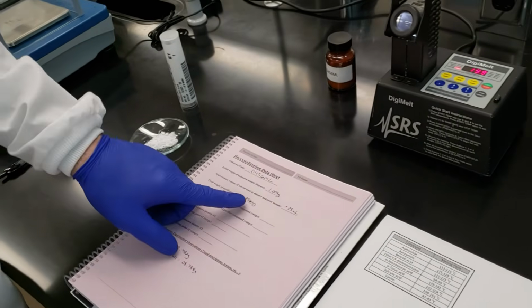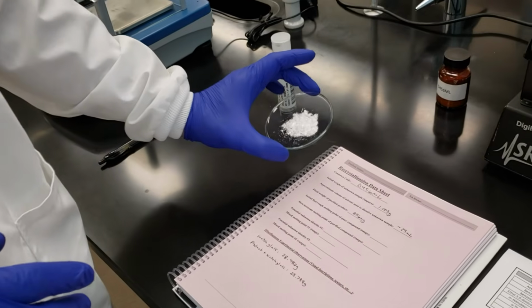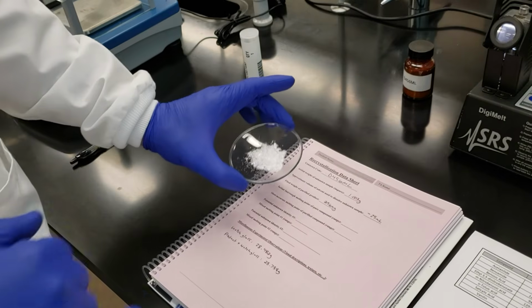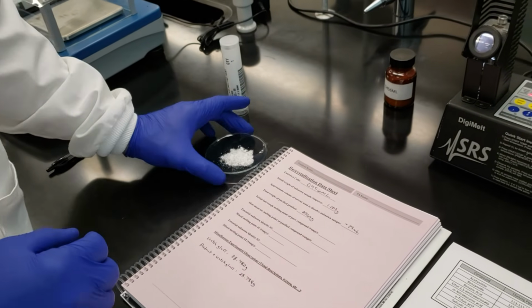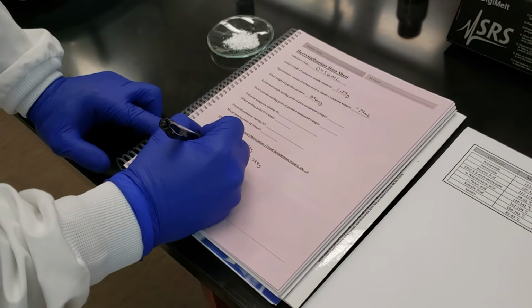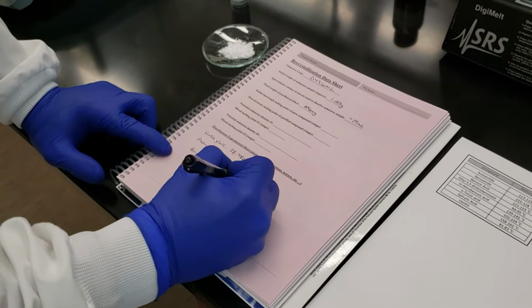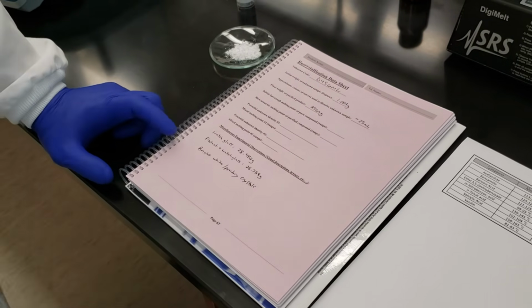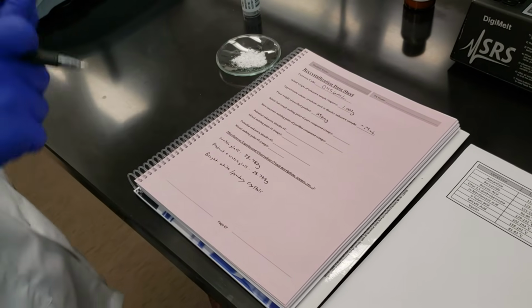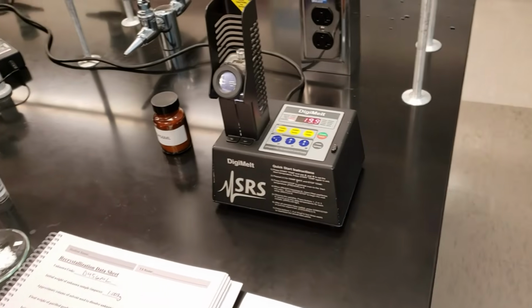So we've determined the total amount of product that we've recovered, 256 milligrams of our purified, recrystallized crystals here. The next step is to find out its identity. We've got white powdery crystals here, and I'll go ahead and write that down under my observations. I'll say bright white powdery crystals. All right, so we're making sure that we've got our observations, visual descriptions, and whatnot. We've got our weights listed out. So we need to use melting point determination to determine the identity of our unknown.